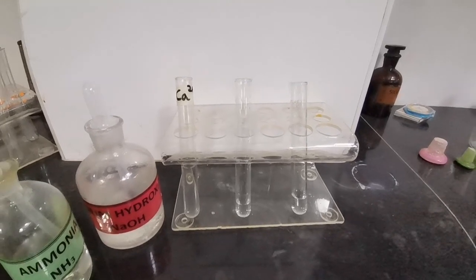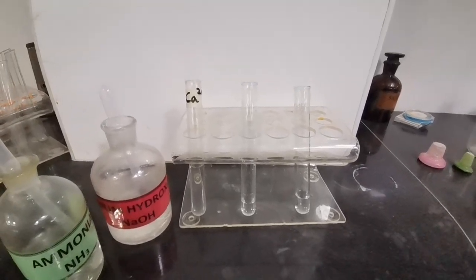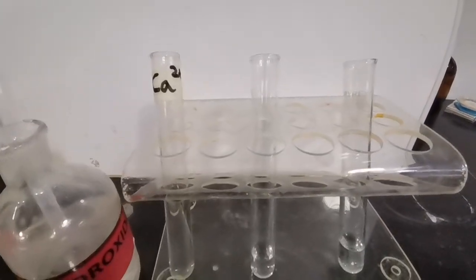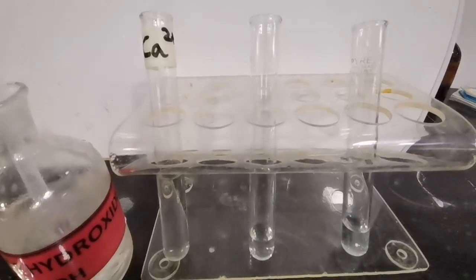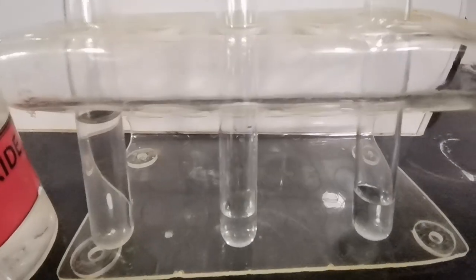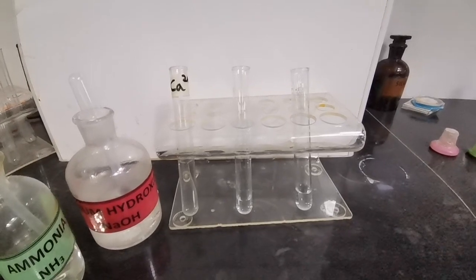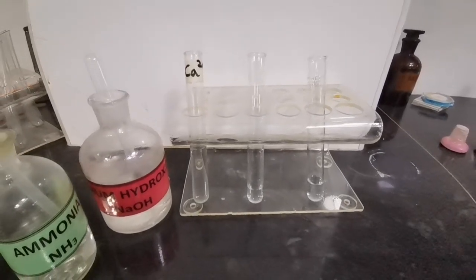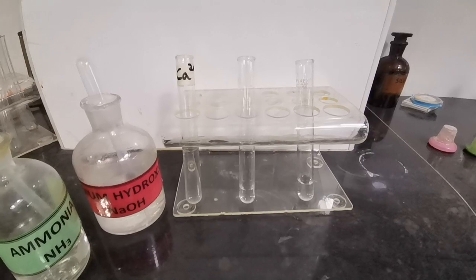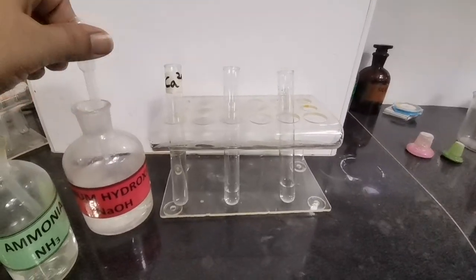We are testing for the presence of Ca²⁺ ions. Here we have a soluble solution of calcium ions with a colorless appearance. We are going to test for the presence of calcium ions by addition of sodium hydroxide and ammonia dropwise and then in excess. We start off with sodium hydroxide.